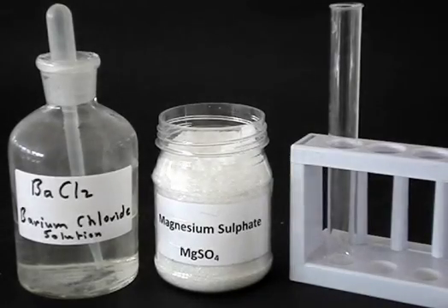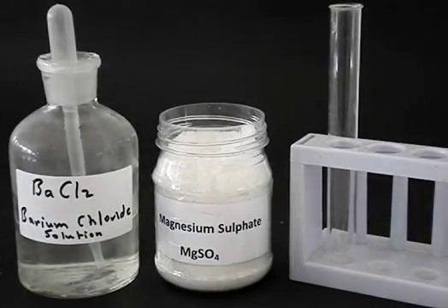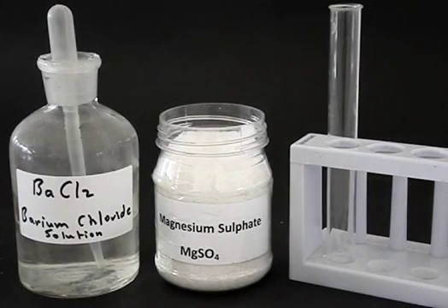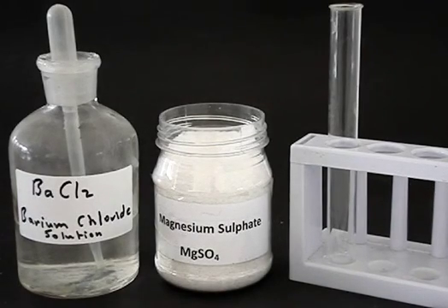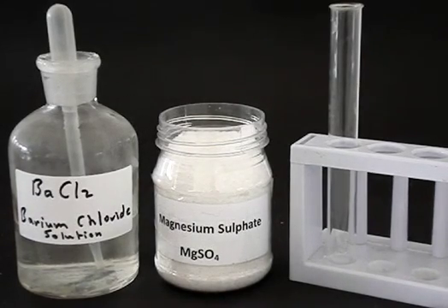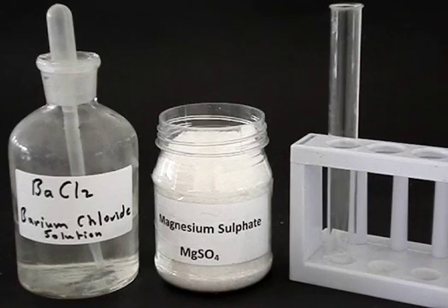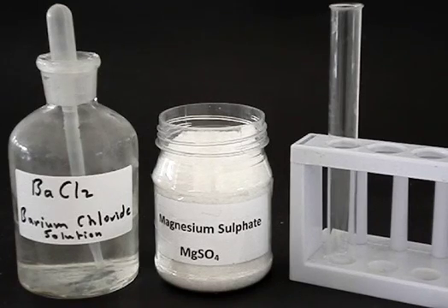Magnesium sulfate is a white crystal. It's an ionic substance, meaning it consists of ions — positive and negative ions: Mg²⁺ ions and SO₄²⁻ compound ions.